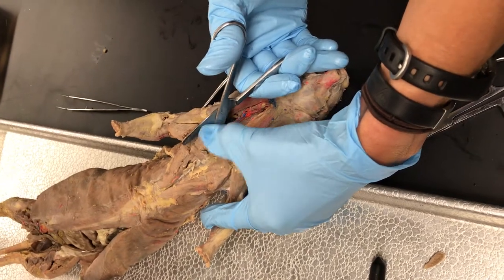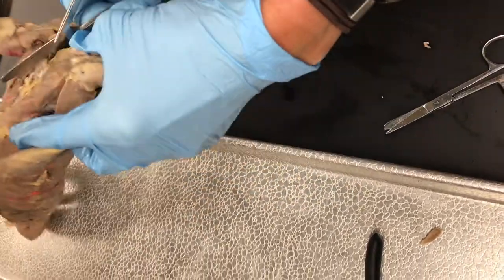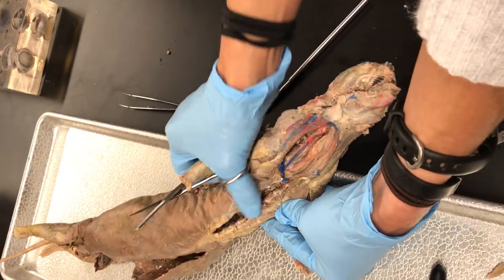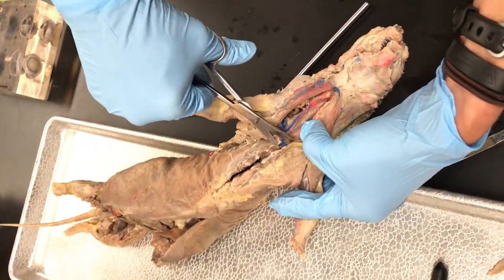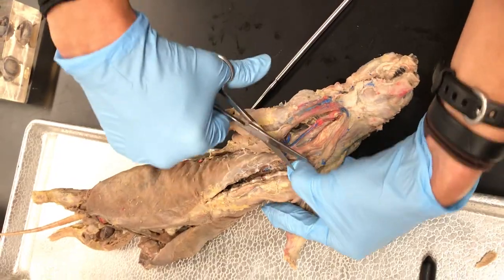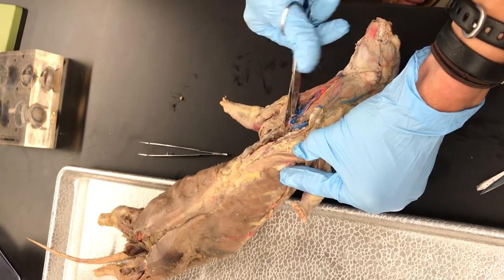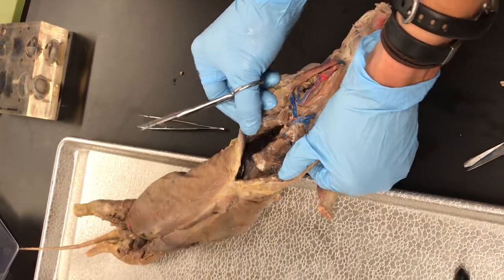You want to try and keep your scissors above the veins. You're going to hit the rib cage about the time you get level with his arms. Put your scissors under the rib cage - now I've got one part of my scissors under the rib cage. You can cut through the ribs no problem with most of these scissors. Go all the way down. Watch your fingers because sometimes when you cut them or start to pull back, it can snap them and they have sharp edges, so you don't want to cut your fingers.